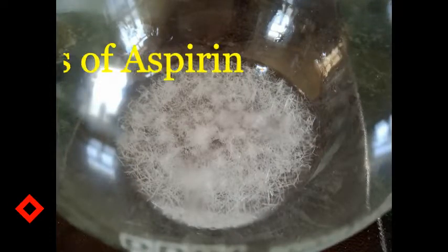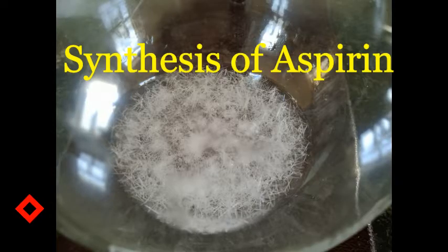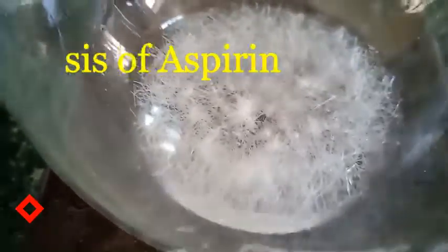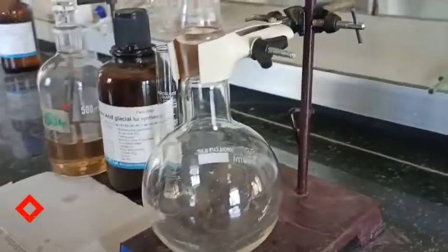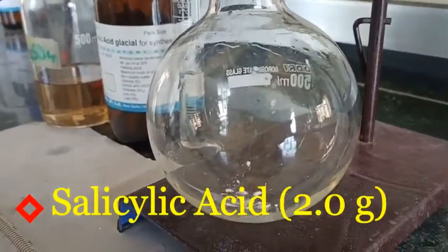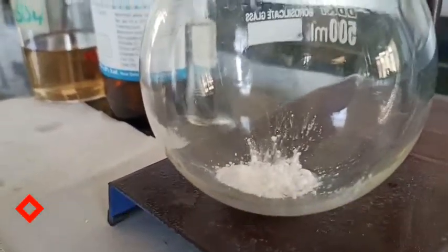Hello everyone, welcome back to Spectrum Classes. In this video we are going to synthesize aspirin drug by using salicylic acid and acetic acid. Since acetic anhydride is banned, I have applied to purchase it, but in the meantime I have to perform this experiment using acetic acid. I have taken 2 grams of salicylic acid and transferred it into the round bottom flask.